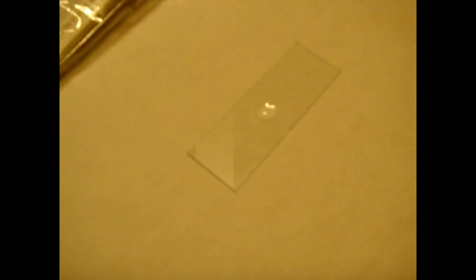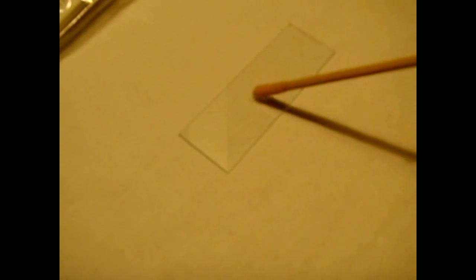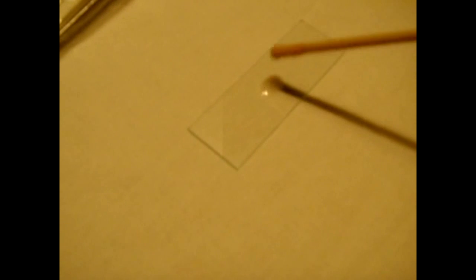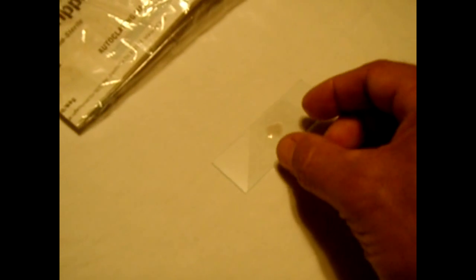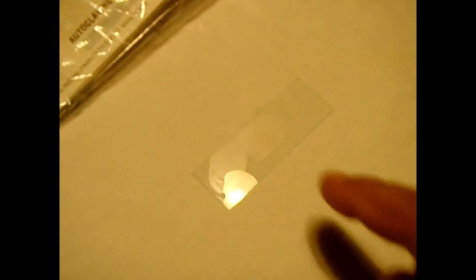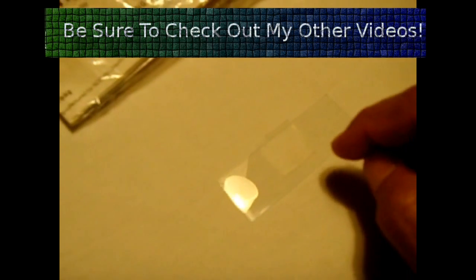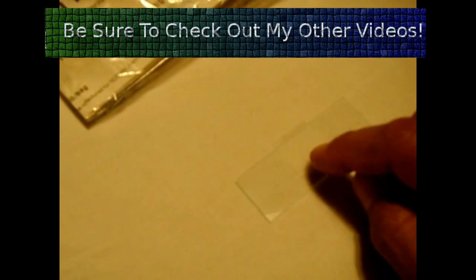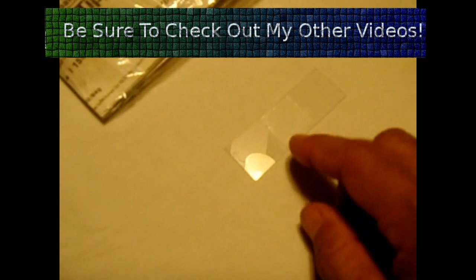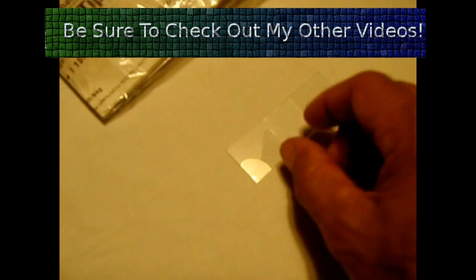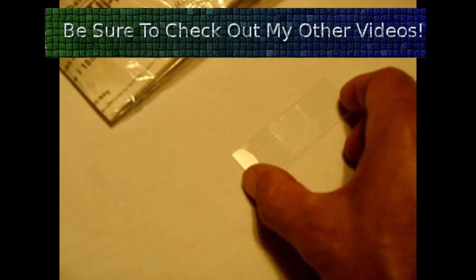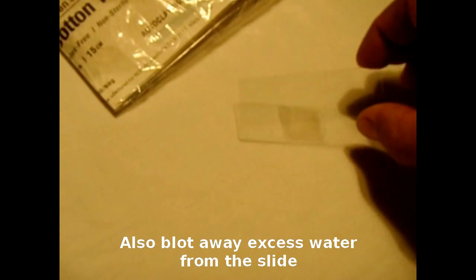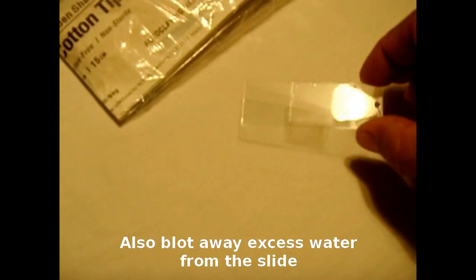Next I'm going to take a little bit of yogurt, mix it with the water. The next step is to place a cover slip over the top of that solution and that went down nicely. You slide it this way a little bit. Once that cover slip is applied, just make sure there's no air bubbles in there. That looks pretty good and I can now place it in the microscope.